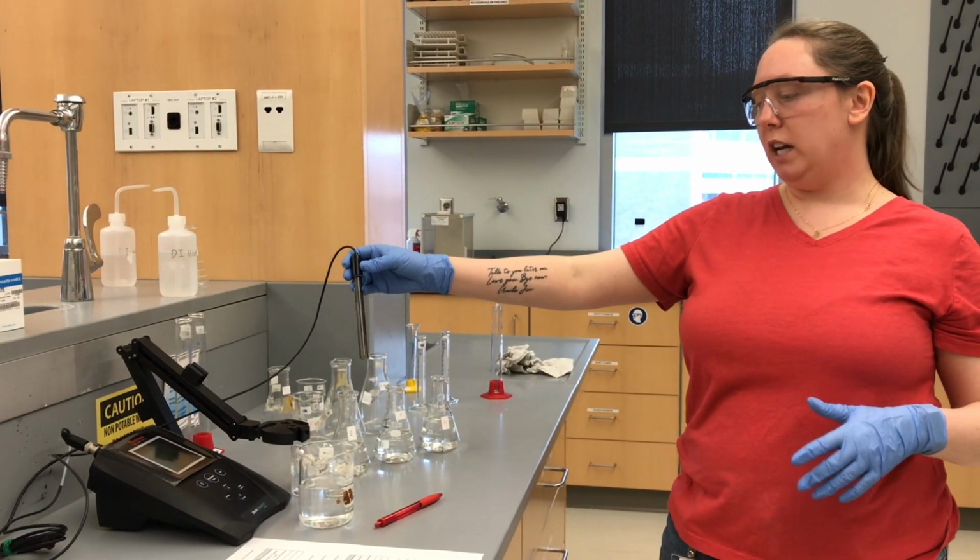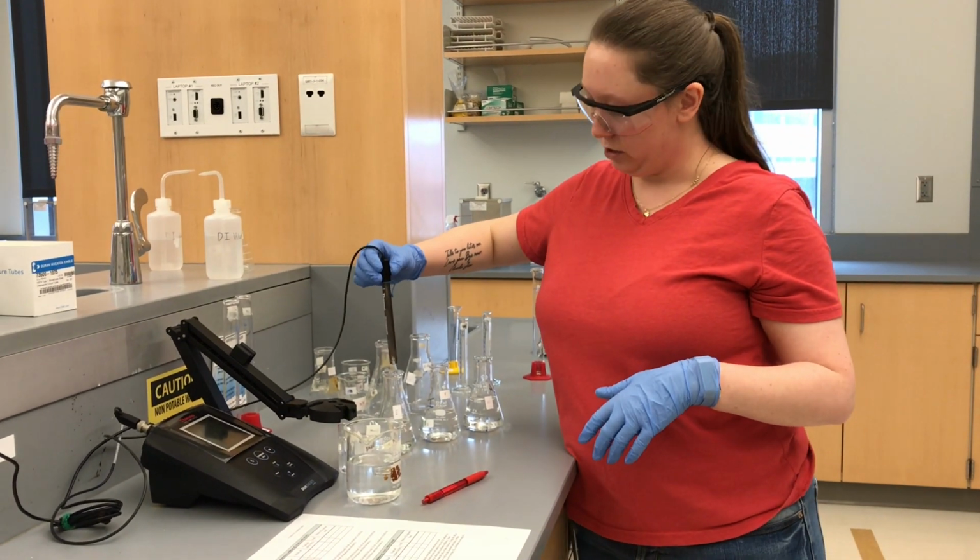So now I'm going to read the pH of our E solution.